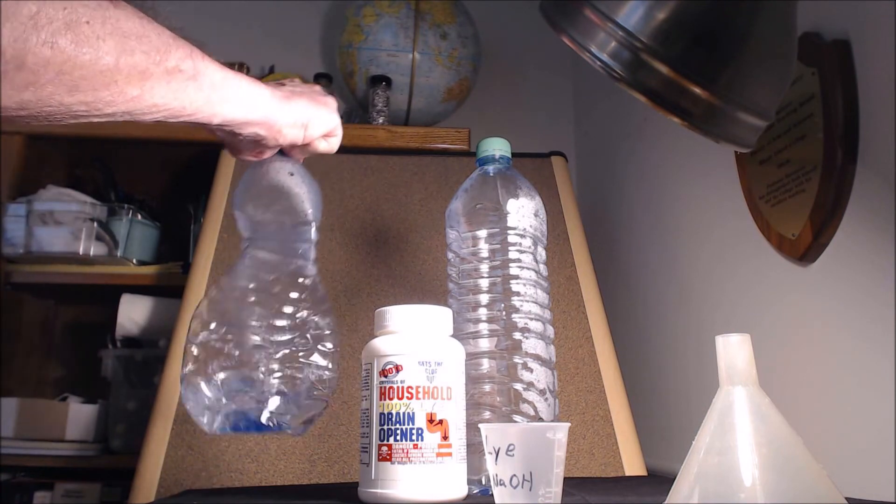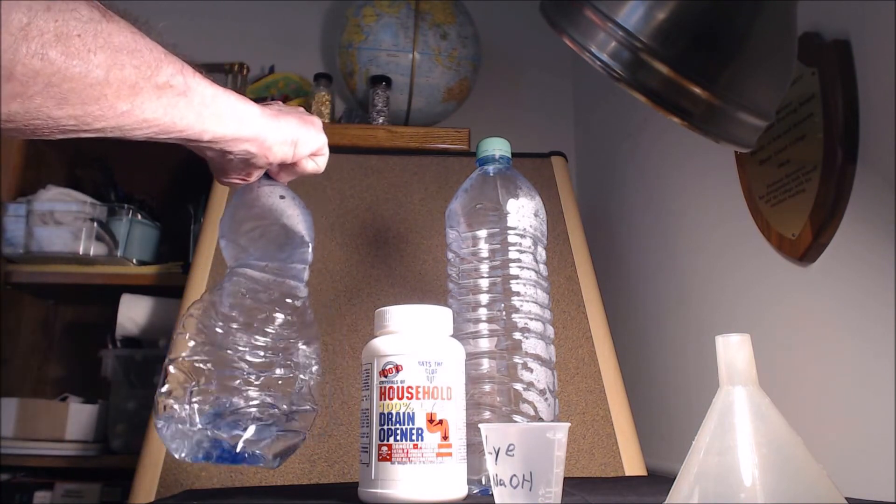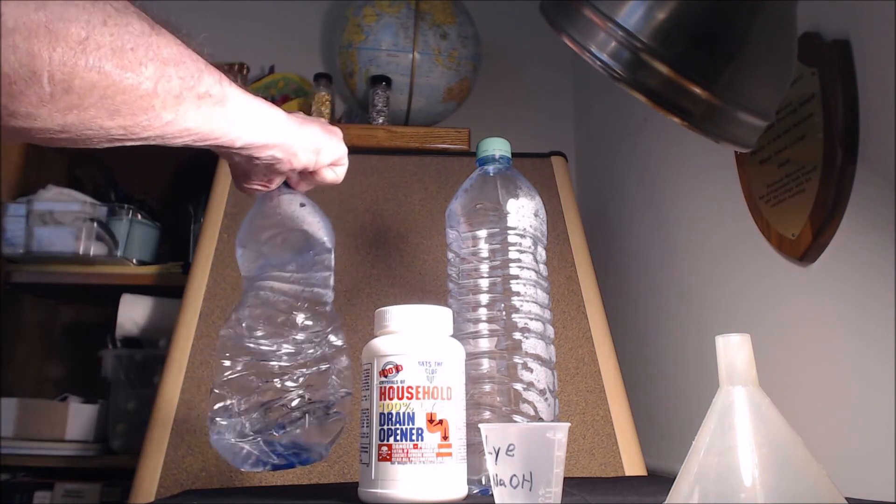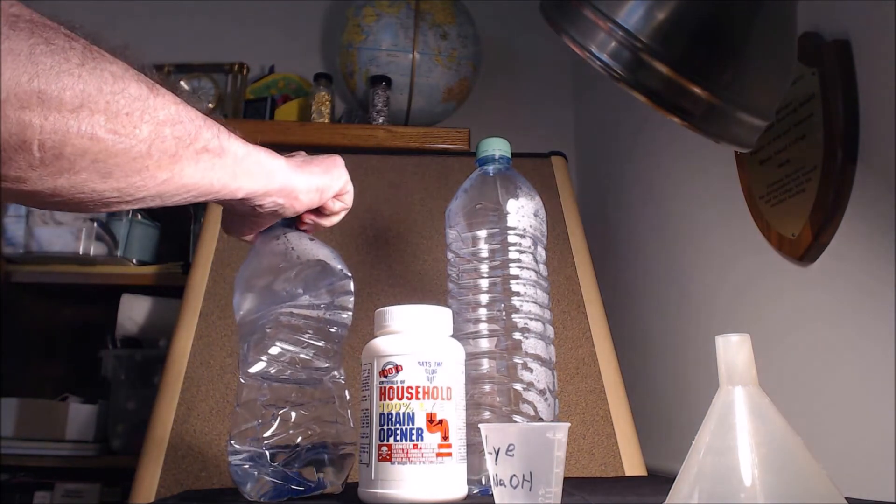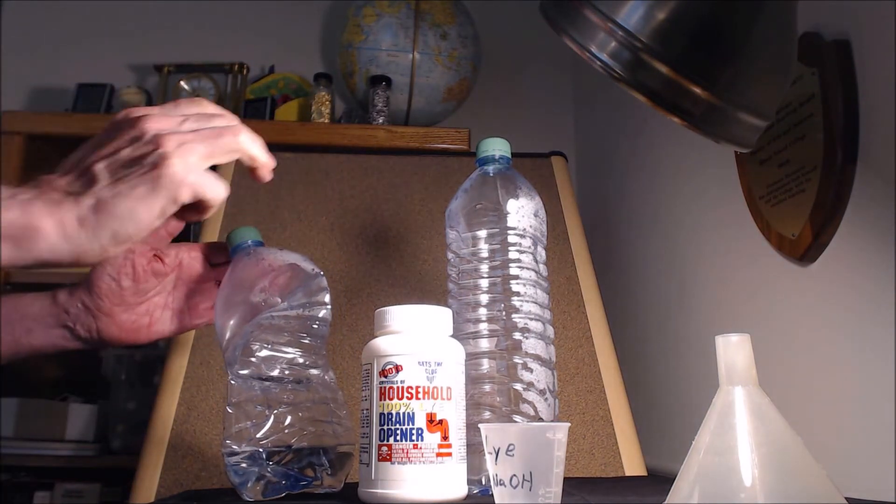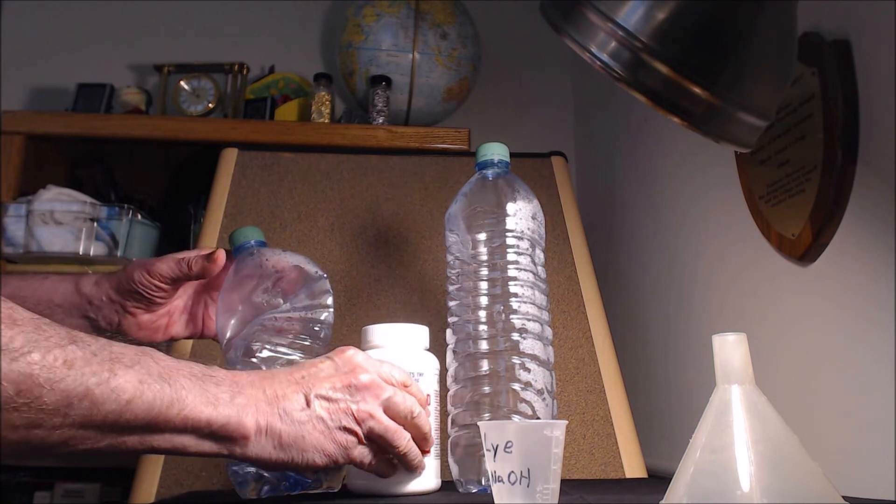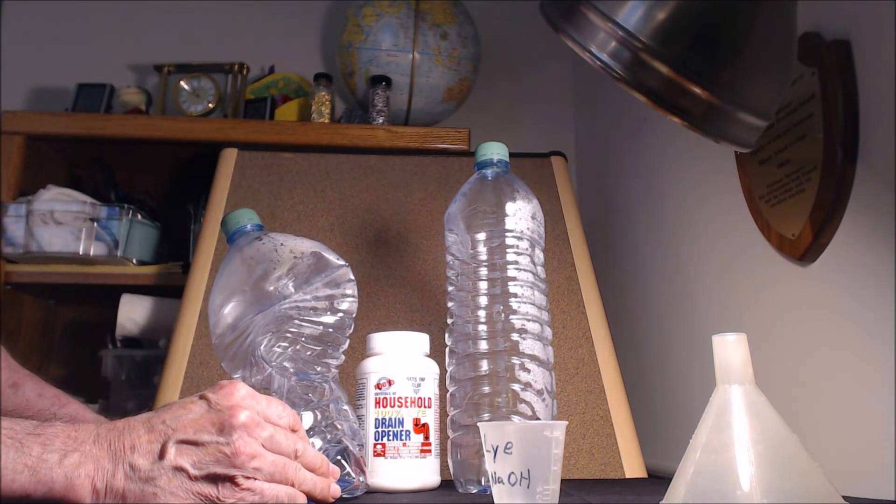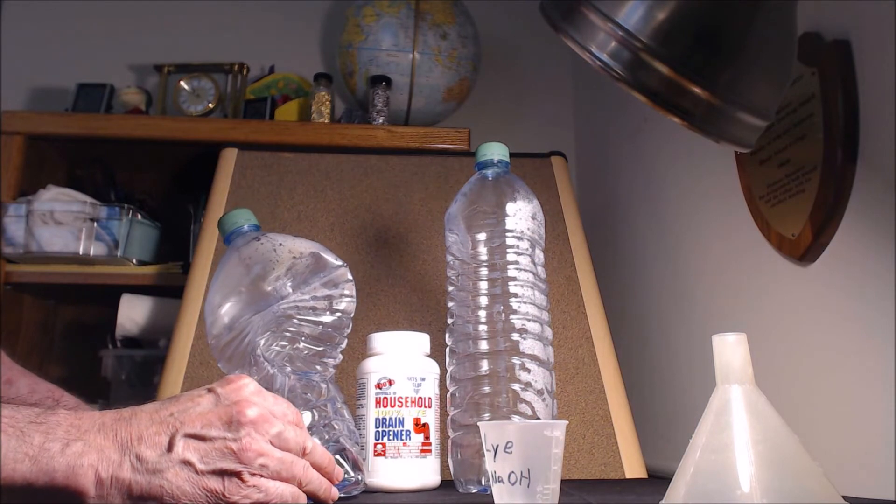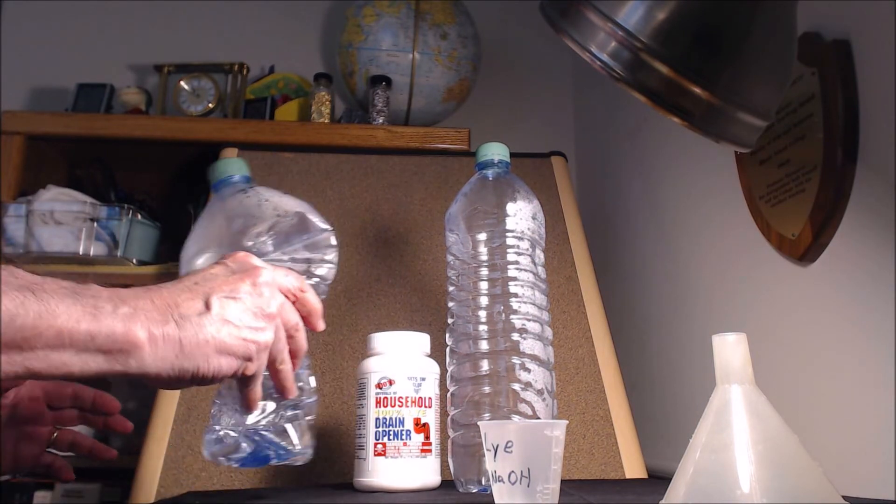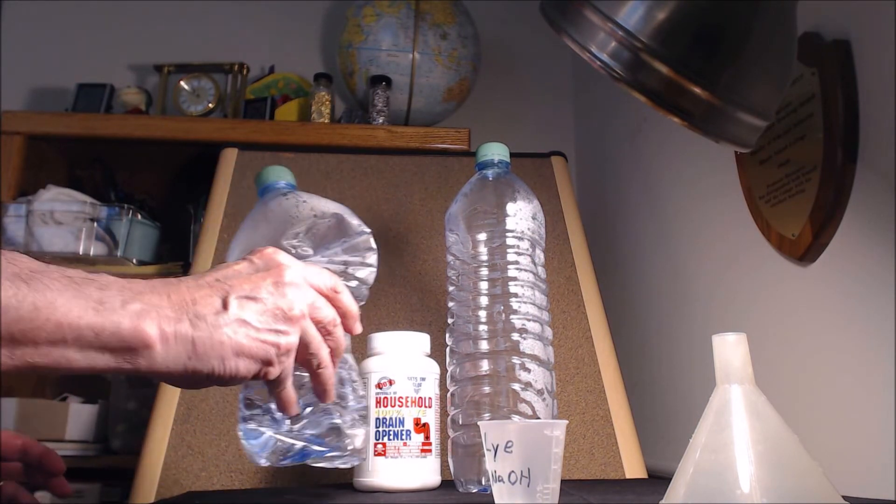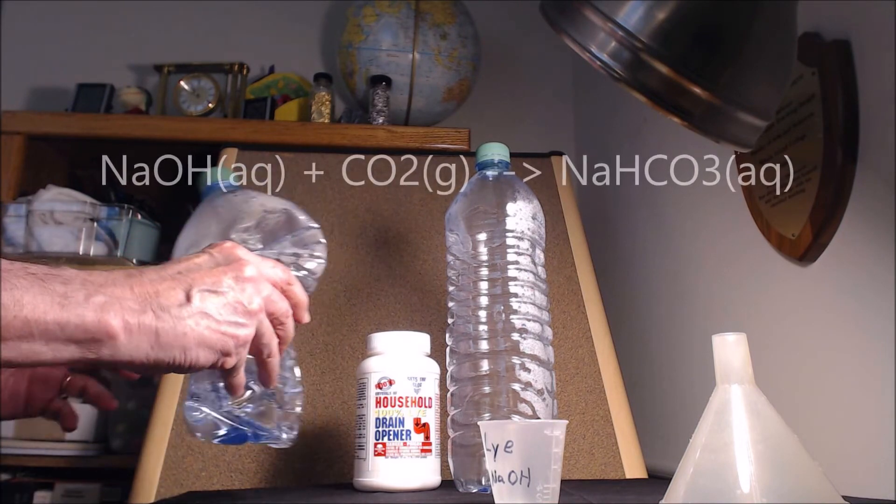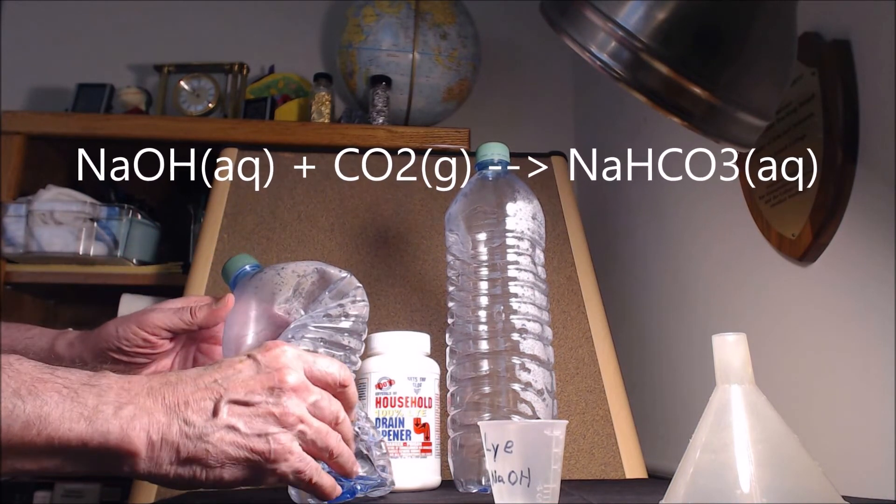The bottle is collapsing! I love it, I love it, this is just fantastic and we have the contrast with the other bottle. It's exothermic, you can feel the heat. Part of that is this heated solution of the sodium hydroxide. The kids will love this, the kids will love it.